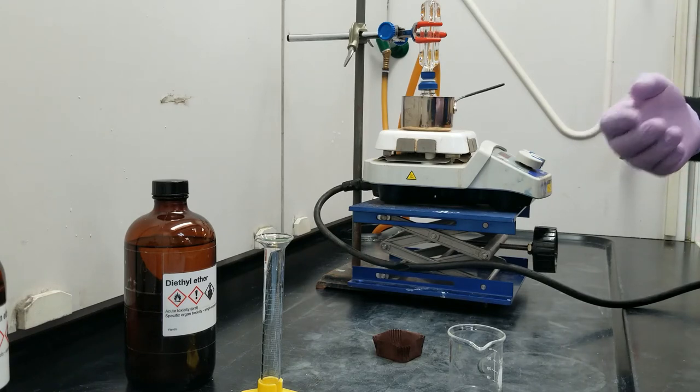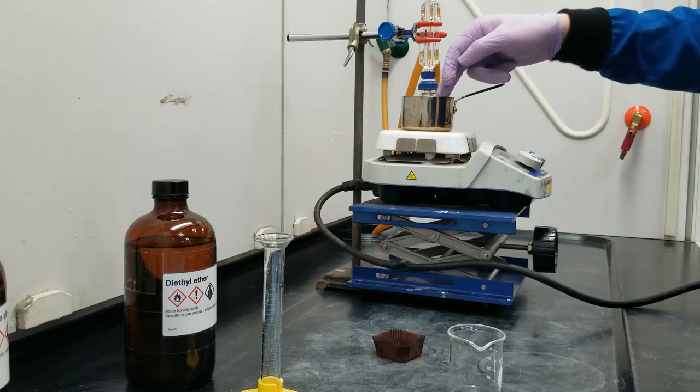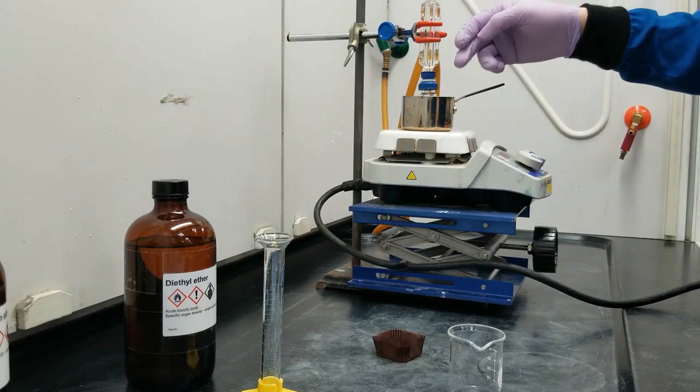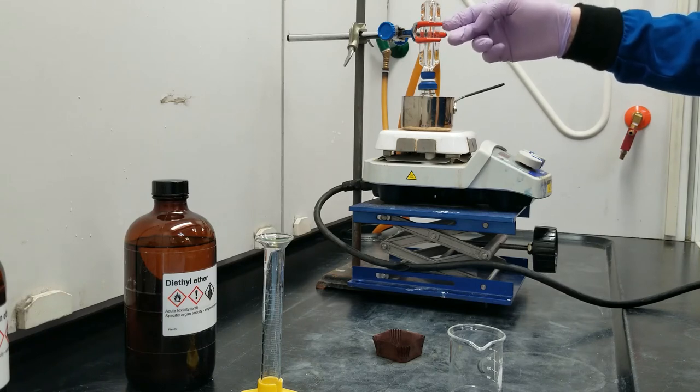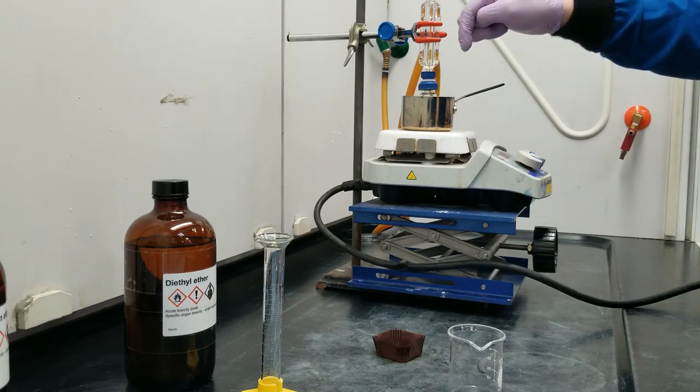If I don't see that, that's okay, as long as the vapors are either clouding up the top part of this glassware, or even better, if I'm seeing my reflux condenser working, and it's cooling down the vapors, and they're dripping back down into solution.